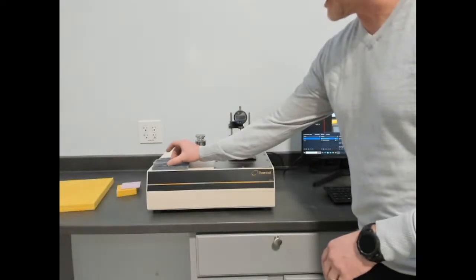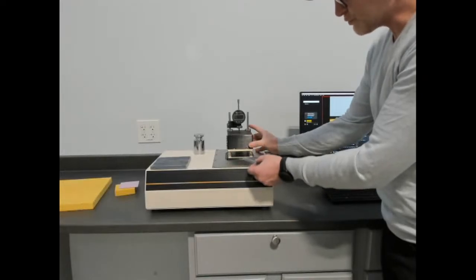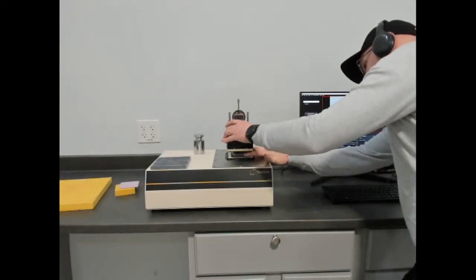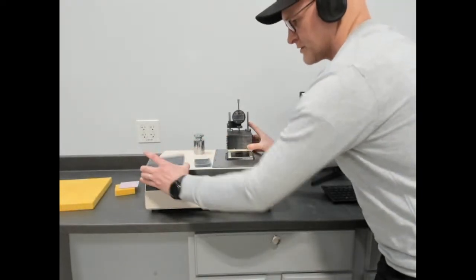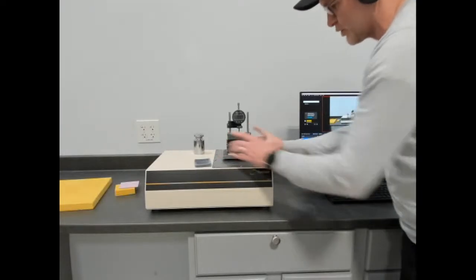So for making a measurement, you would lift the upper plate and insert the sample, and make sure that you're covering, and I'm sorry the camera angle won't allow you to see it, make sure you're covering the flux sensor like that. Of course, if you were measuring a larger material, such as the same material, just larger square, it's a lot easier to set up. You don't have to be quite as sensitive.